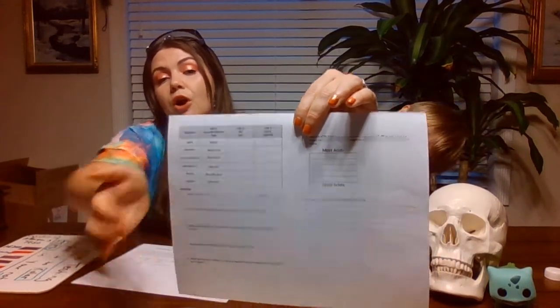You'll be filling out mostly this chart right here as I'm going through the lab. Now if you'll notice the first column I did fill in for you because it's just a little hard to completely see it and you'll see why in just a second. So here we go, we are moving into the lab portion so you need to be ready to write these things down. So if you need to pause and go figure out what you can be writing down, you might want to do that now.